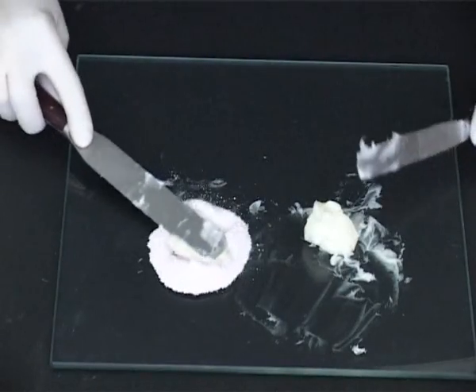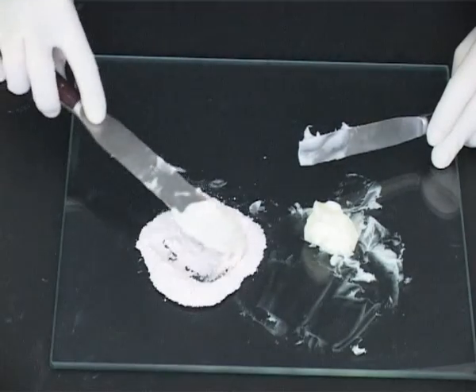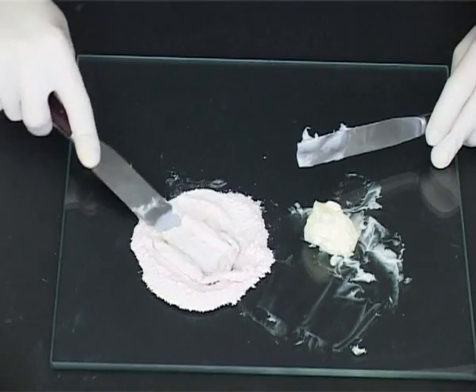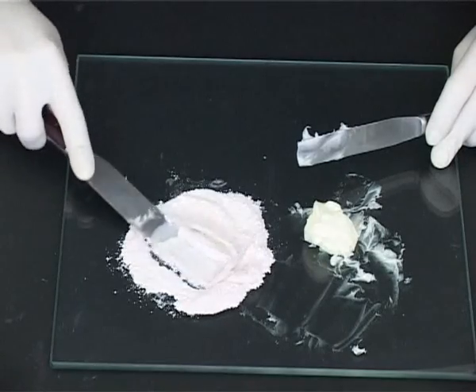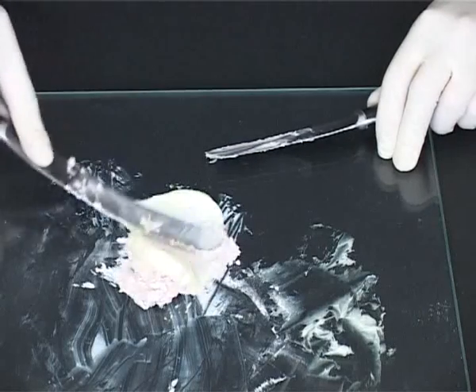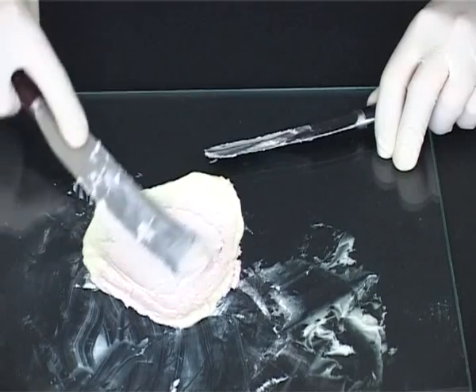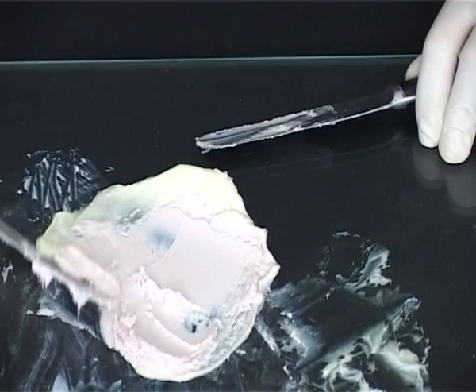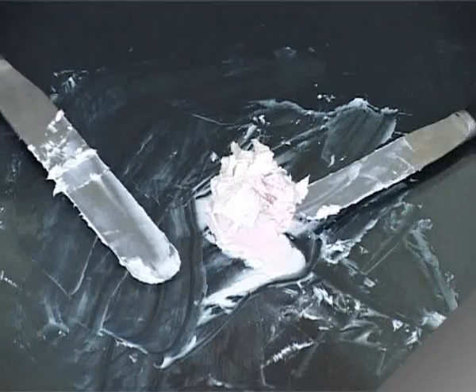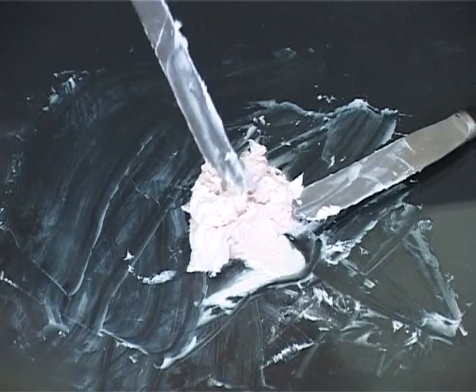Levigate the pre-prepared powders and base together. Again, considerable shearing force should be applied to avoid a gritty product. Gradually incorporate the remaining base by trituration, always remembering the basic principle of doubling up when mixing. When the powders have been incorporated, any liquids are triturated with the ointment on the tile.